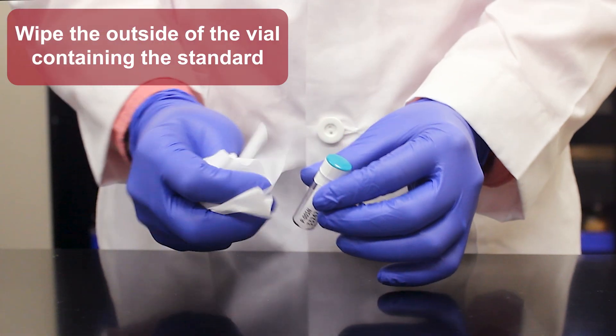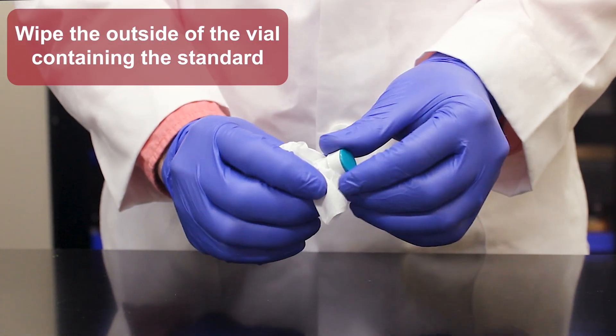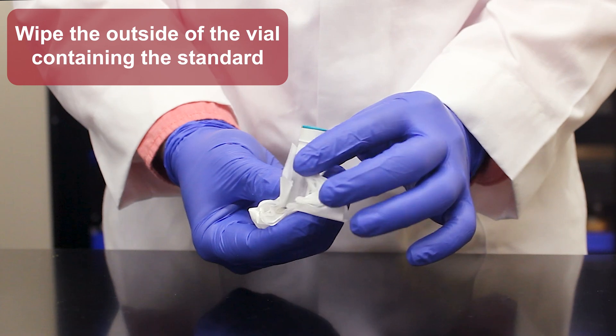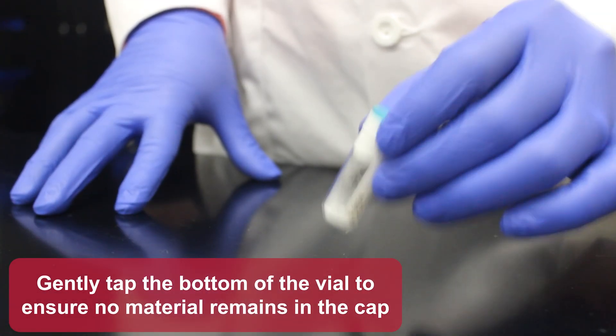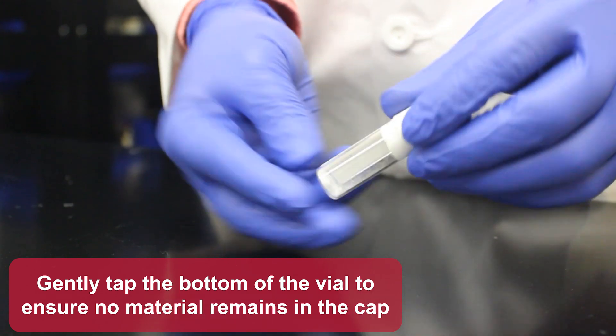Wipe the outside of the vial containing the standard. Gently tap the bottom of the vial to ensure no material remains in the cap.